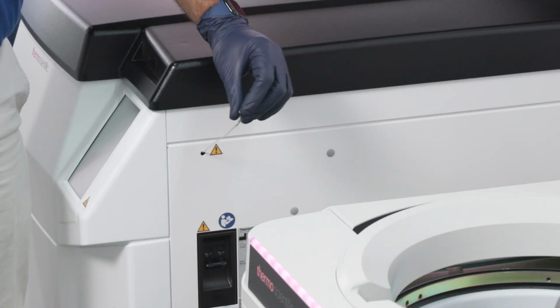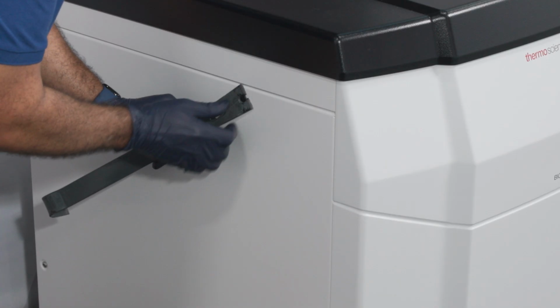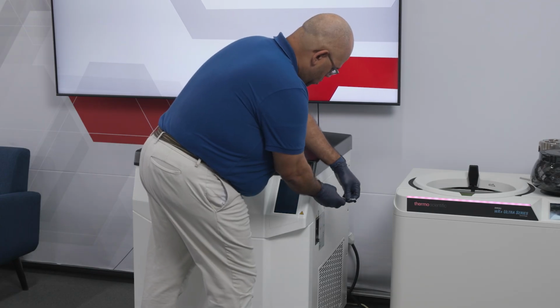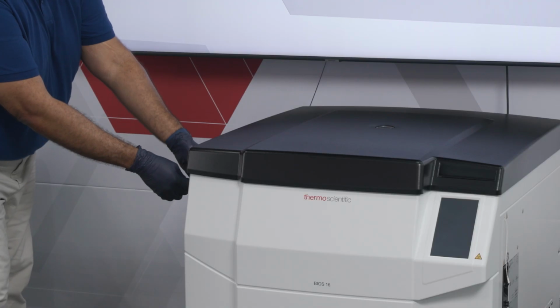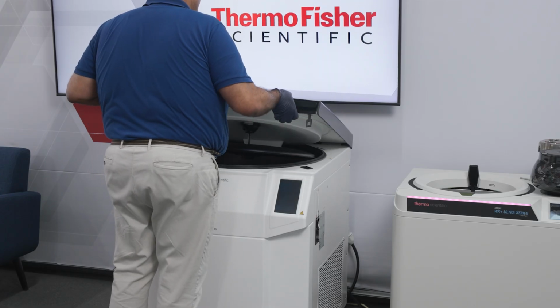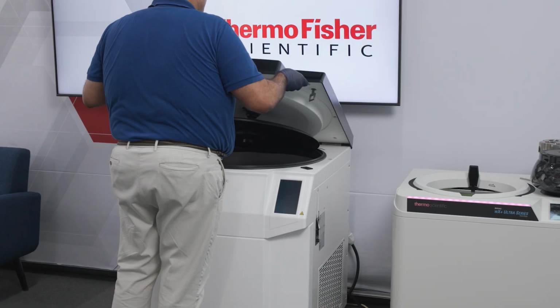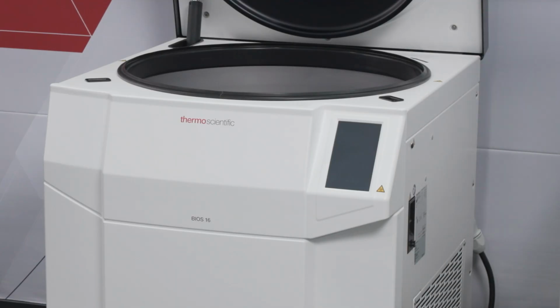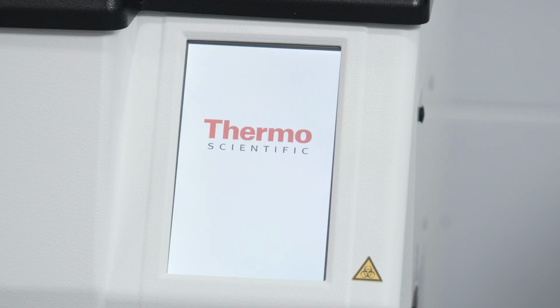Then remove the two plastic plugs from both sides of the housing. Pull the release cords on both sides of the centrifuge to trigger the mechanical door release. Use adequate force to manually lift the centrifuge door. Then, replace the release cords and plugs into the housing. Reconnect the power supply once the power failure is over.